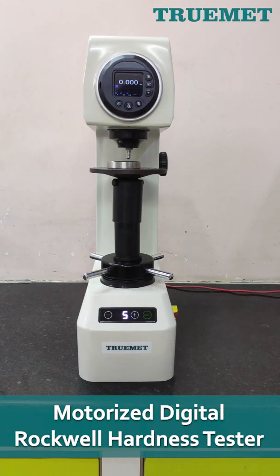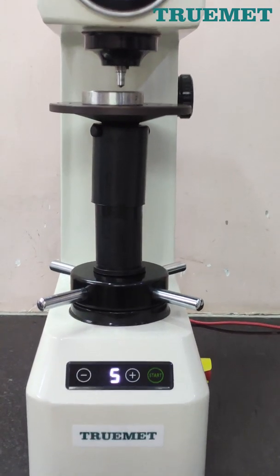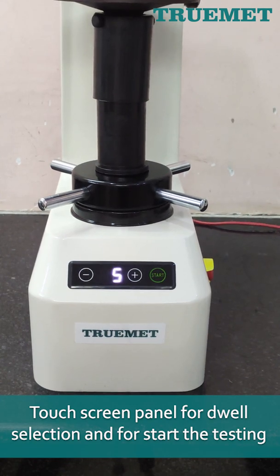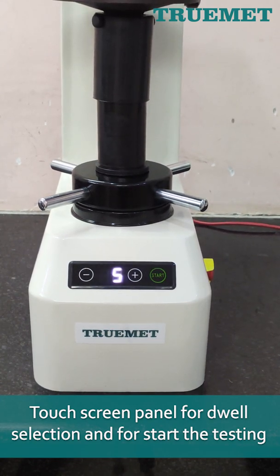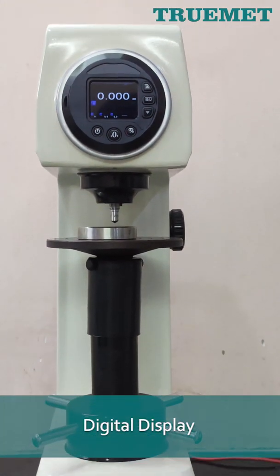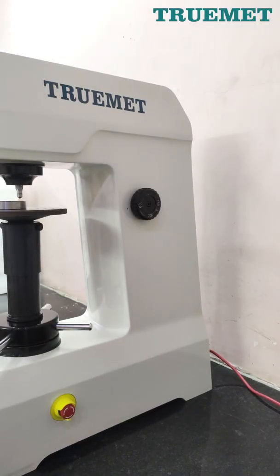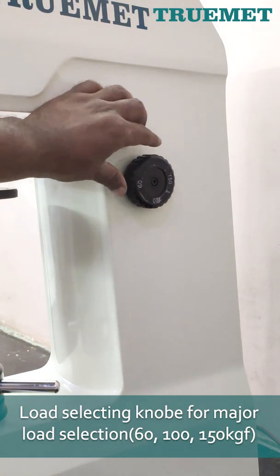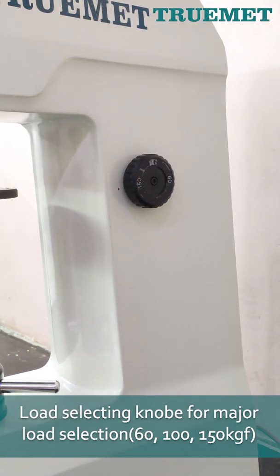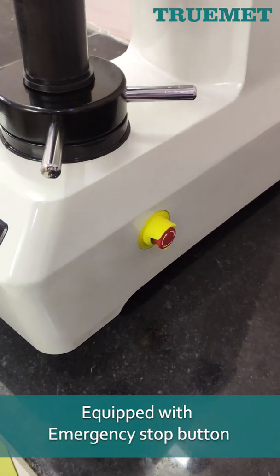Motorized Digital Rockwell Hardness Testers. Touchscreen panel for dwell time selection and for starting the testing. Digital display. Load selecting knob for major load selection. Equipped with emergency stop button.